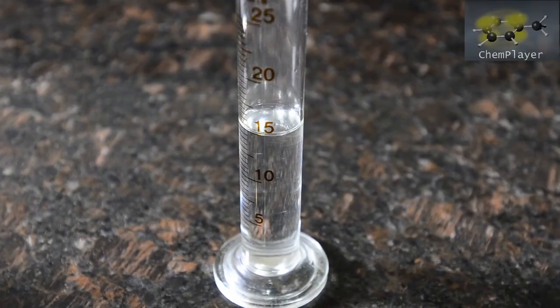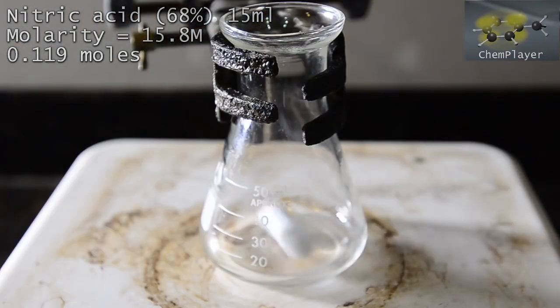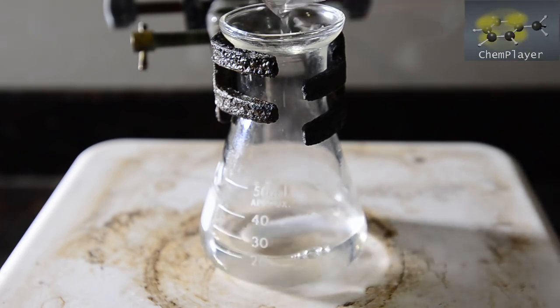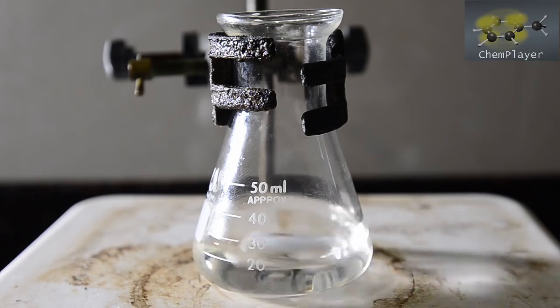Here's our oxidizing agent: 15 ml of 68% concentrated nitric acid. First we pour this into the flask. And now all we're going to do is add 5 grams of our benzoin to the nitric acid. Let's get the stirring dialed up.